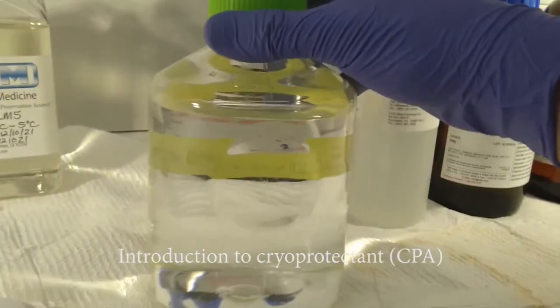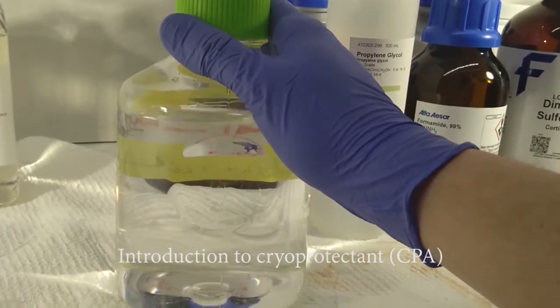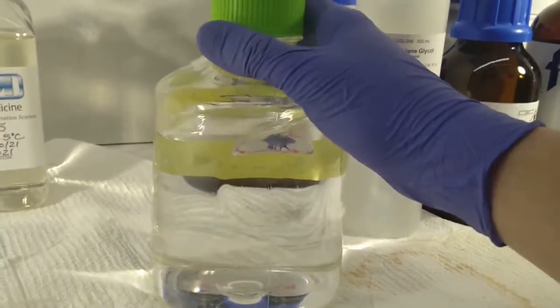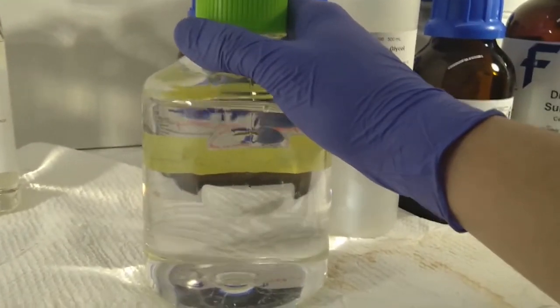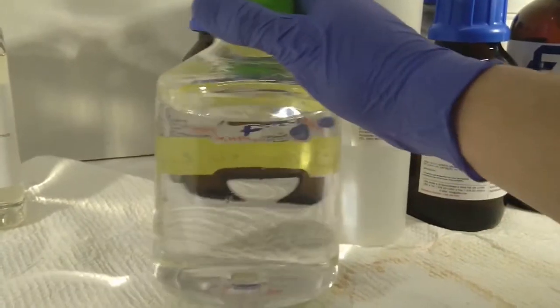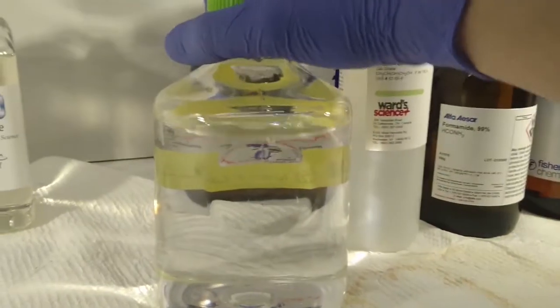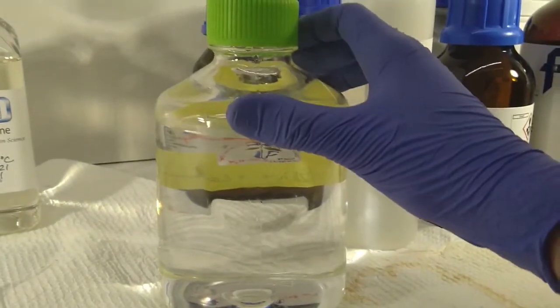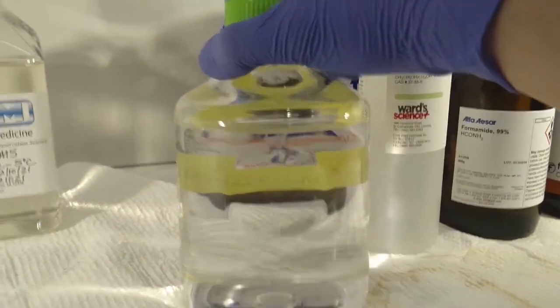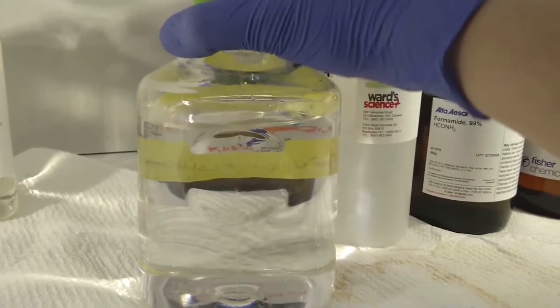So the main purpose for the CPAs that we use is effectively to control the formation of ice. And what I mean by that is to eliminate the formation of ice entirely. So if I take this CPA and I cool it faster than 2.5 degrees Celsius per minute, I can actually bypass ice, effectively supercooling it. And if you cool it low enough, once you cool the solution down to its glass transition, for which this CPA is about negative 123 degrees Celsius, you can actually turn the whole solution into an infinitely viscous, amorphous solid that we call a glass.